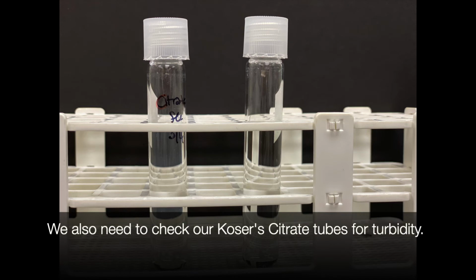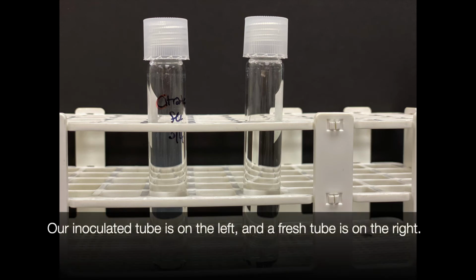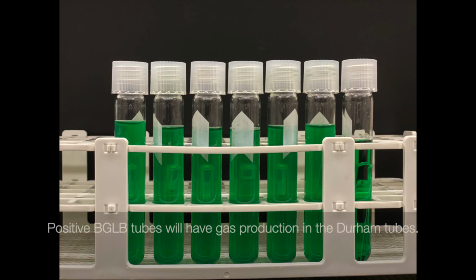We also need to check our Koser citrate tubes for turbidity. Our inoculated tube is on the left, and a fresh tube is on the right. We also need to check our BGLB and E. coli broth tubes. Remember that by day 5, they've been inoculated for 48 hours.